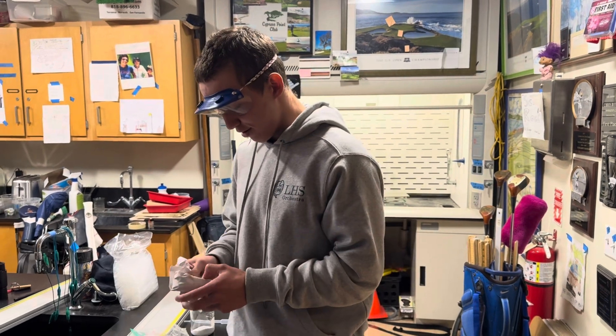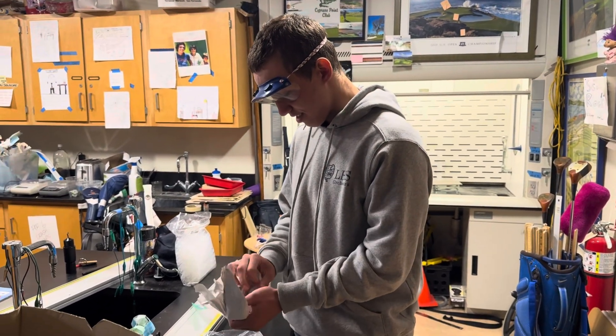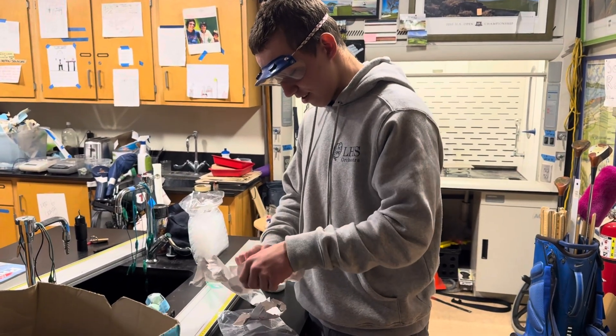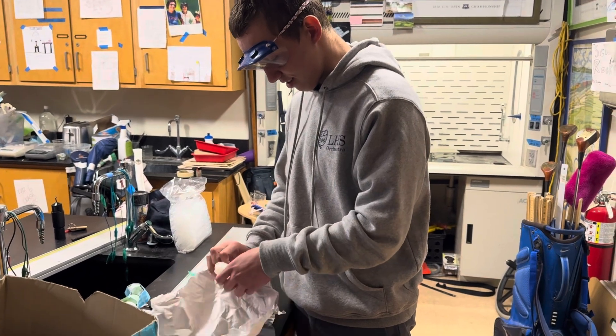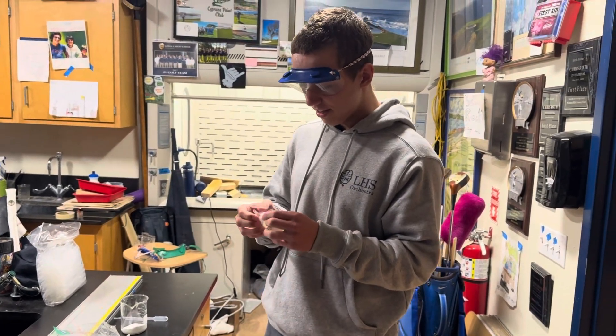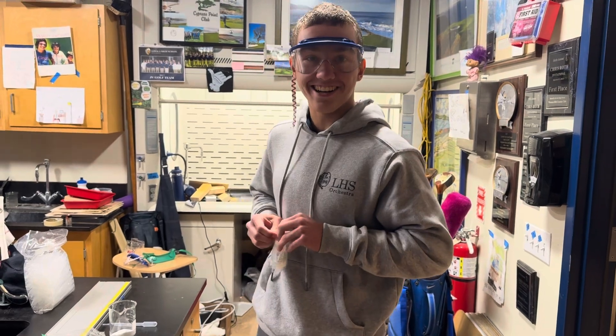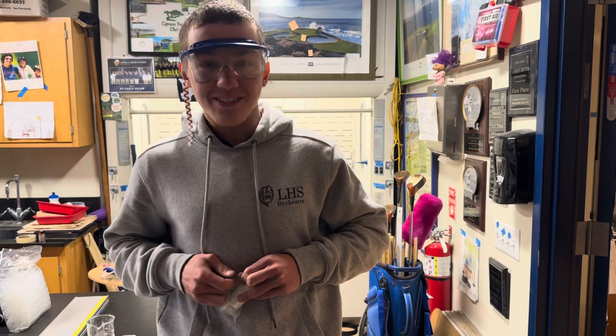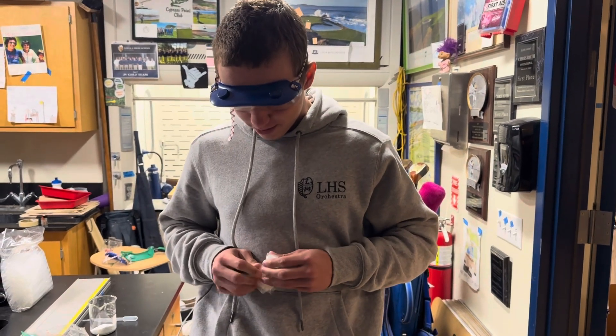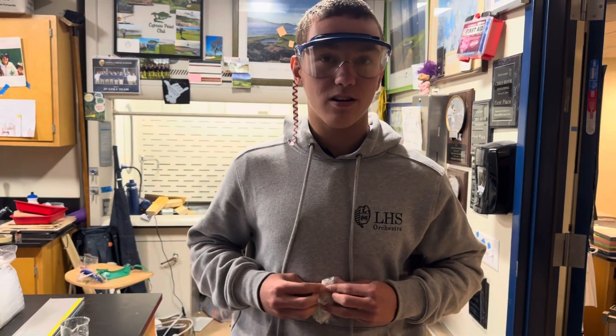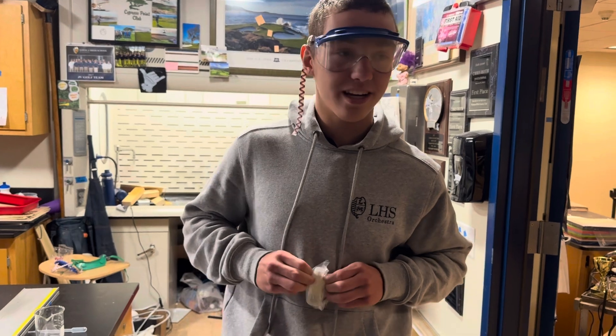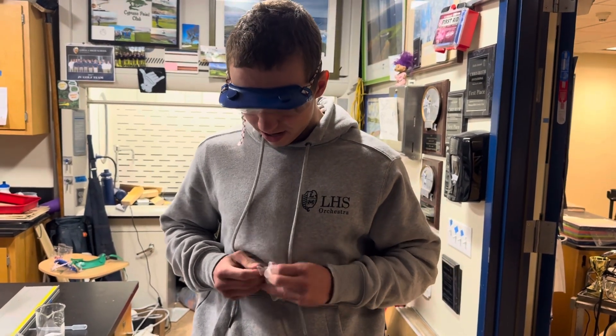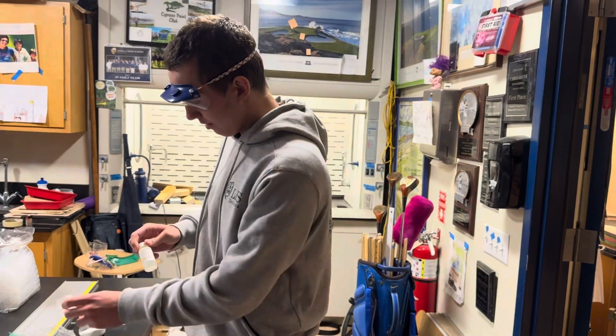And yeah, so here we go. Open the pan and we have it. Any safety considerations? Yeah, make sure you do this in a hood. Not the hood, but a hood. So for proper ventilation, because it does release chlorine gas. And oxides too, so it's very reactive.